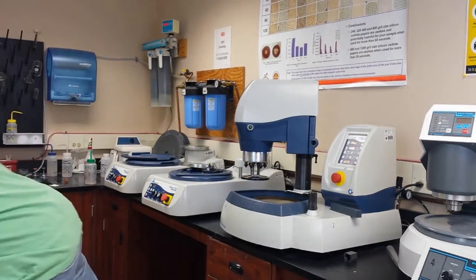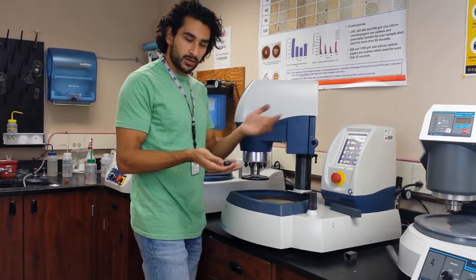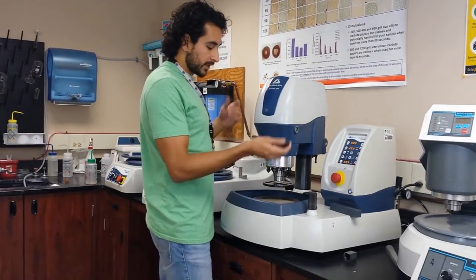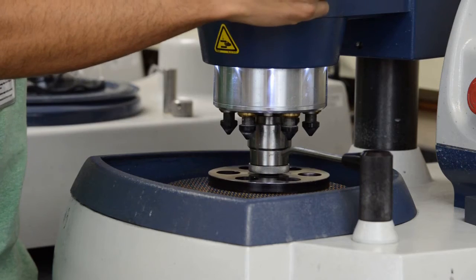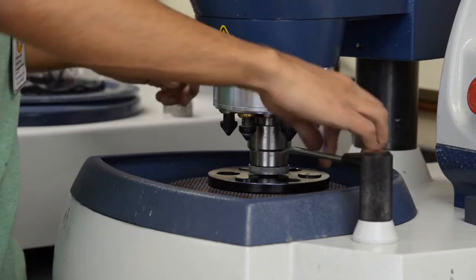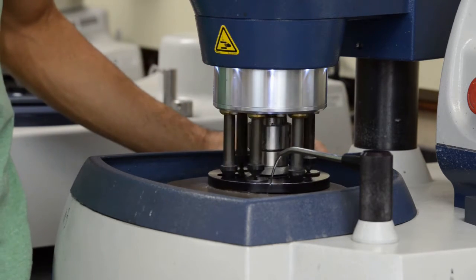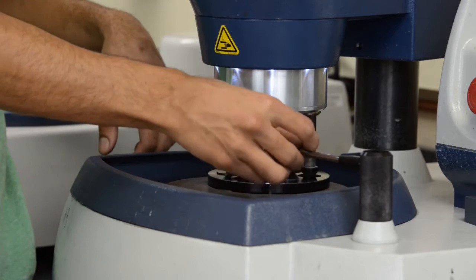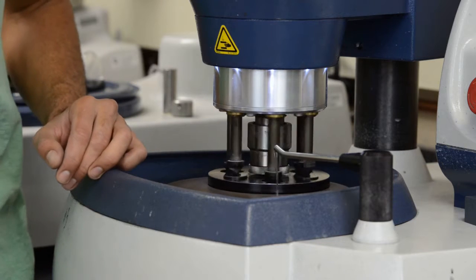My samples are over here — I've already cleaned them. Make sure you've removed any water or anything because you don't want any 600 grit particles still in there. I've already set my settings. Put my samples in and press the two buttons. I want even less water on this one. Now I'm going to wait five minutes and show you guys what these look like.